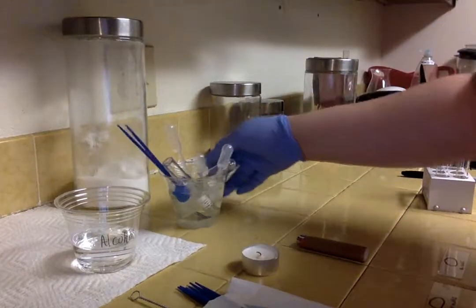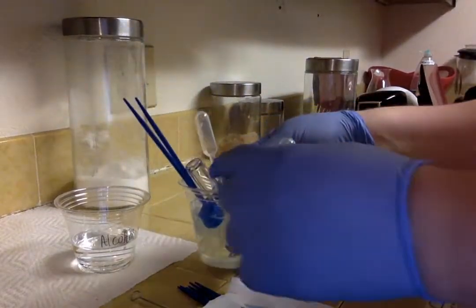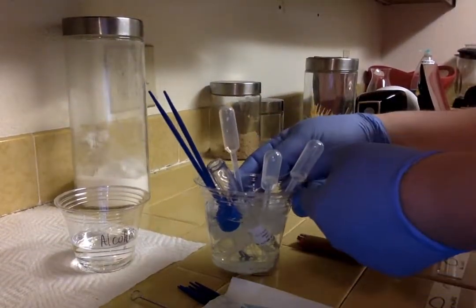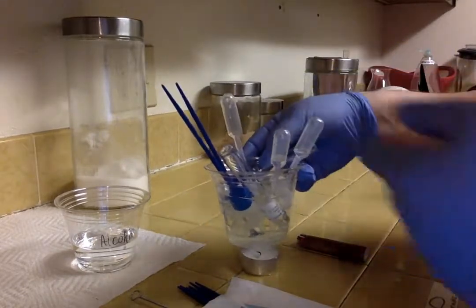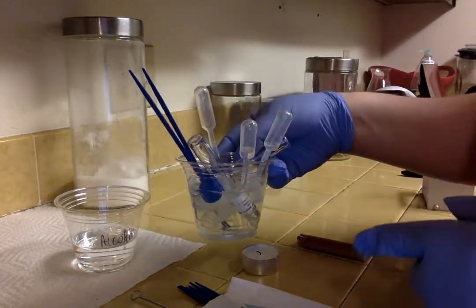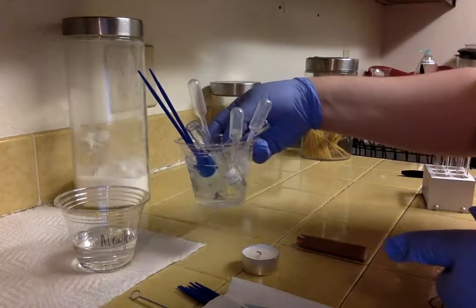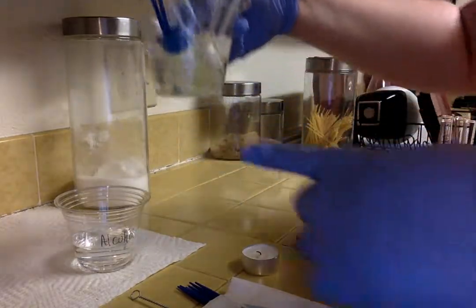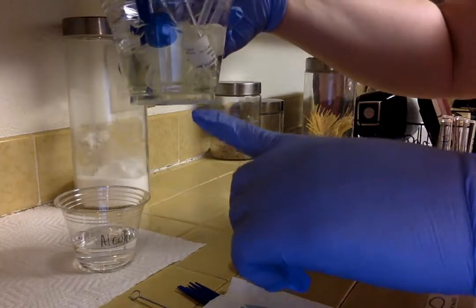These are all the used materials. I use the pipette, the brush, everything that I'm disposing of. It's in the bleach solution. I'm going to clean everything out before I dispose of it. As you can see, some of the stuff has already settled to the bottom.